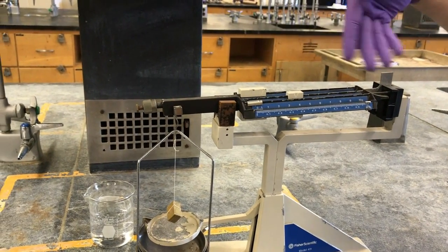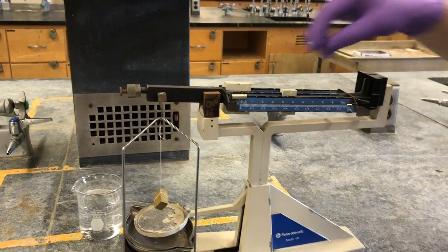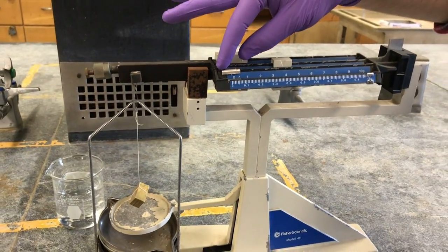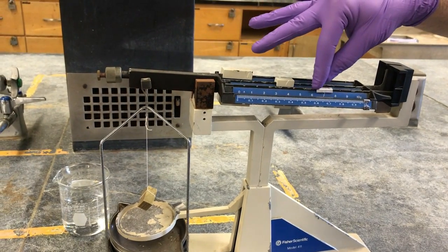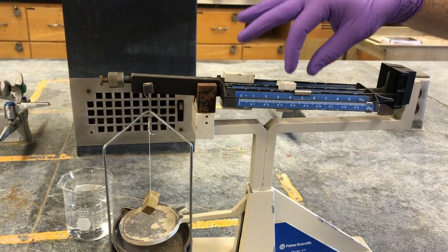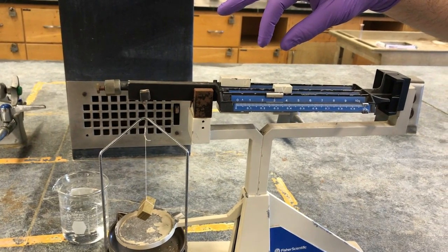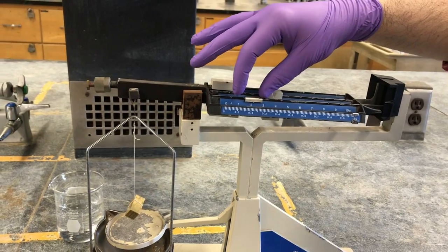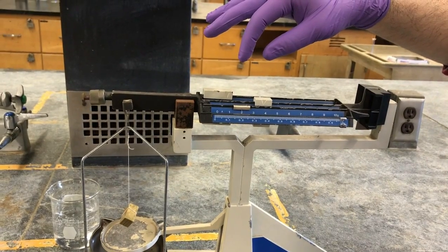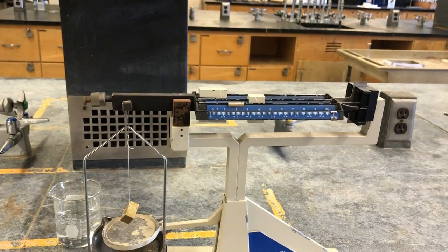So 40, not heavy enough. 50, too heavy. If it's all the way down at the bottom, it means that there's too much mass on this side. So 40 is good, and then we'll move this over to, let's see, 7. Oh, interesting. Still a little too heavy at 43. Which is fine. So that's what you want to do. You want to move it until it's too heavy, and then pull it back and see.